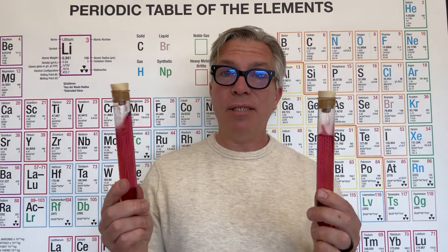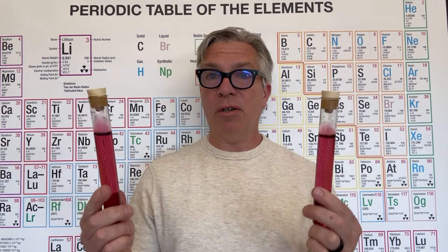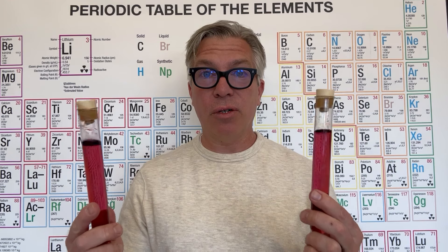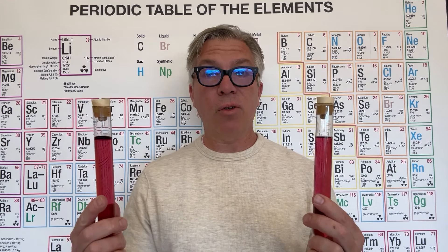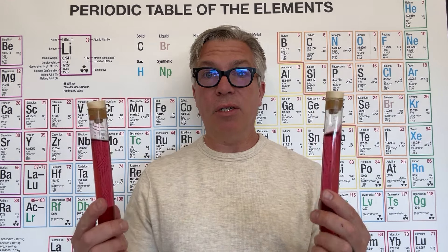Each of these test tubes contains cobalt chloride dihydrate, which I dissolved into some water, and then I also added a little bit of hydrochloric acid to give a bunch of extra chloride ions. I'm going to put these in hot and cold water as well.